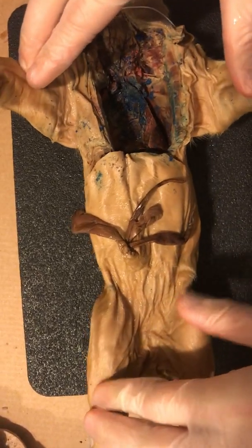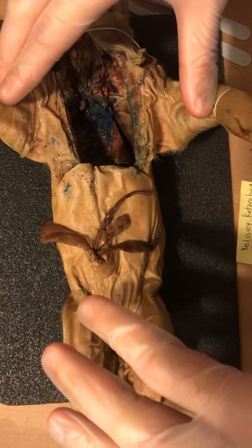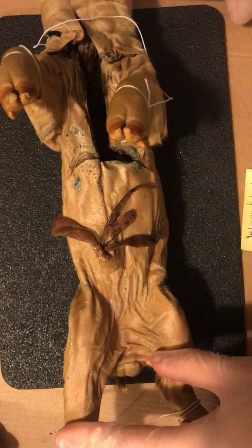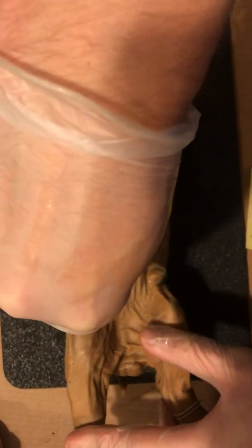We're going to go into the abdomen and essentially reach a region called the retroperitoneal, or the peritoneal membrane. In order to do that, I'm going to need to make two main incisions. I'll just make it right now. So I'll cut around the umbilicus here. I'm seeing rows of tiny nipples, so my suspicion is that this fetal pig is in fact a female.